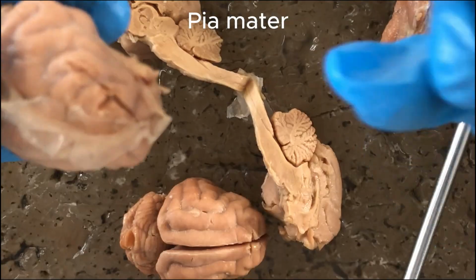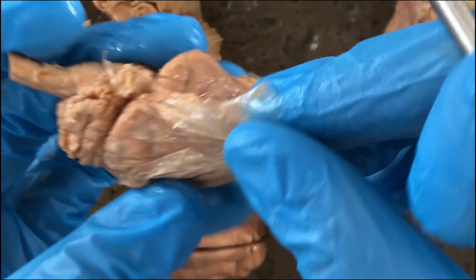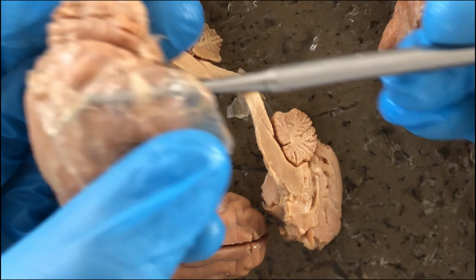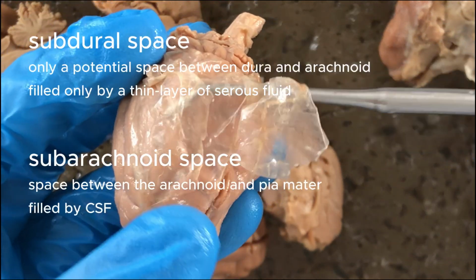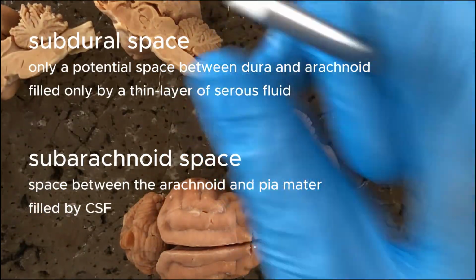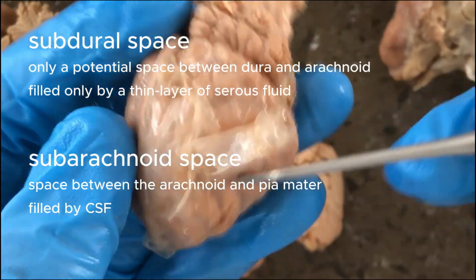So as I said, there are cavities located within or in between the meningeal layers, and the one directly deep to the dura mater is called the subdural space, and the other one would be the subarachnoid space, but we won't be able to see it.